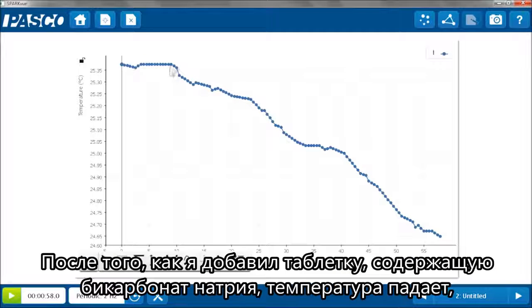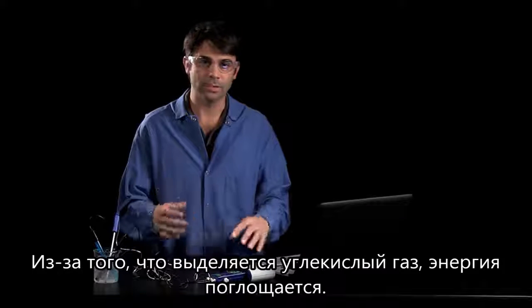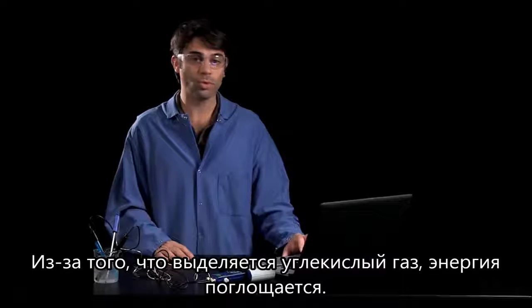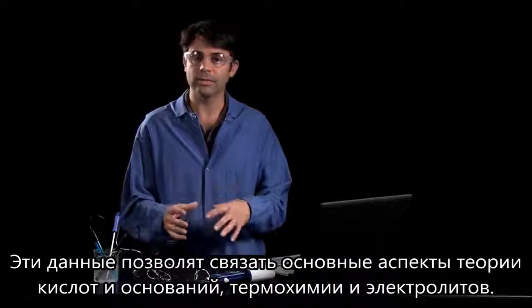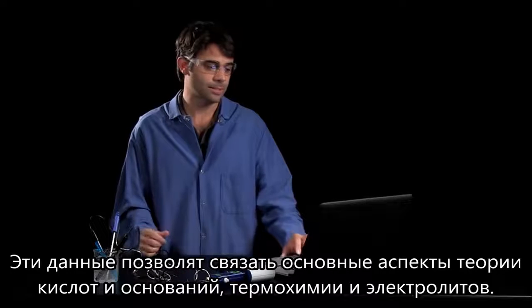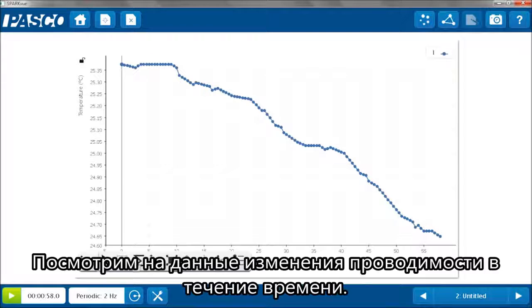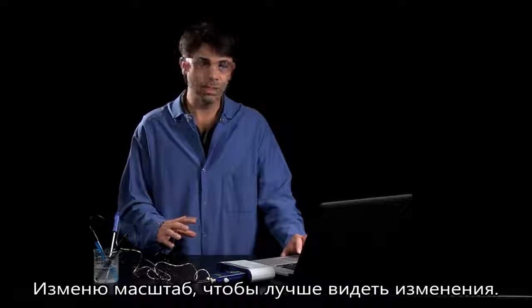After I added my Alka-Seltzer, the temperature is going down because in this case it's an endothermic reaction. As the CO2 is being produced, energy is being absorbed by the system. So now what's happening to the conductivity? Again, tying in some big concepts of acids and bases, thermochemistry, and electrolytes. So we'll go to the conductivity page. Now we have conductivity versus time. Again, we'll auto-scale this so we can get a better look.